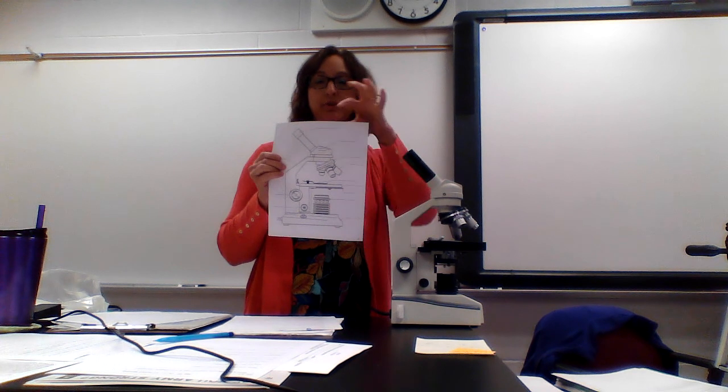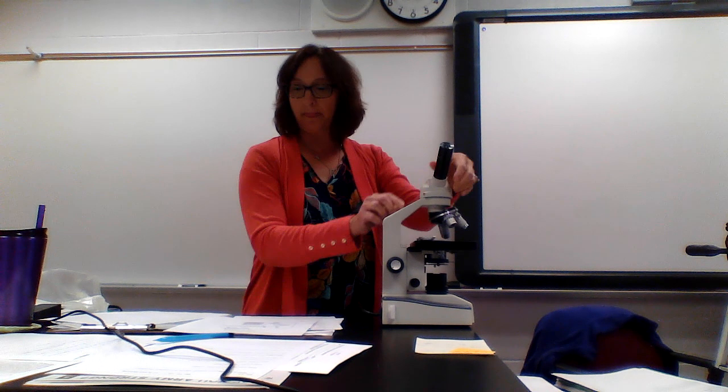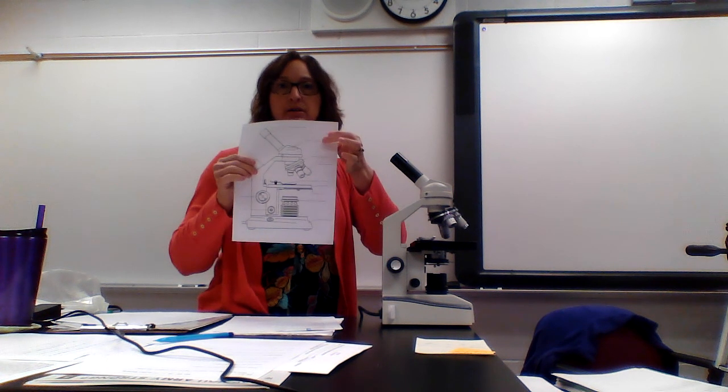Okay, next. So on your sheet, you should have labeled this, the eyepiece. The inclined head is right here. Okay, that's this whole piece right here, and it moves the eyepiece around. So this is really handy when you're sitting at your desk and I'm on the other side of the desk. You can just swing it around and I can see it as well without being on the same side of the desk as you. So the inclined head, that is the second one right here. The inclined head moves the eyepiece around.